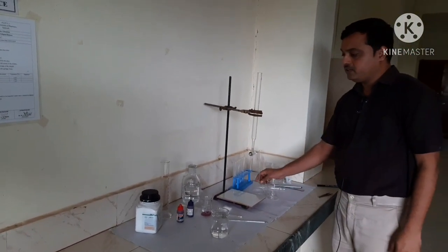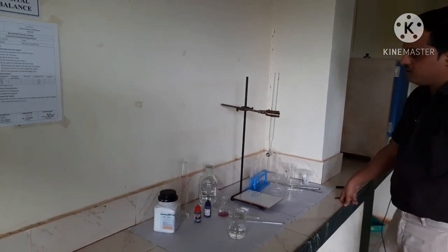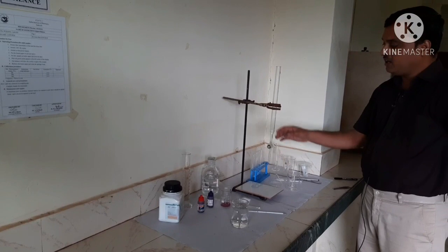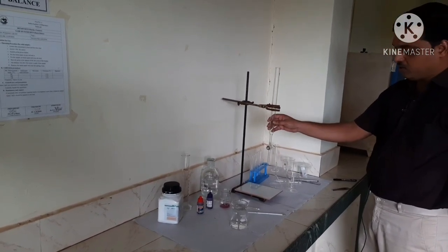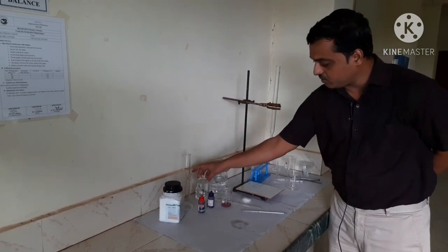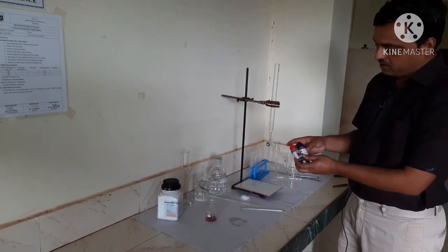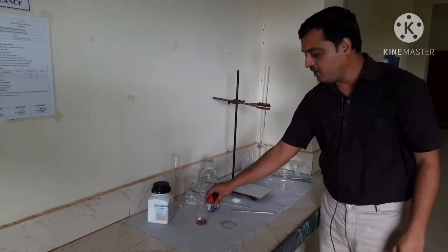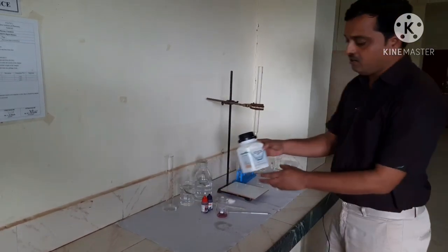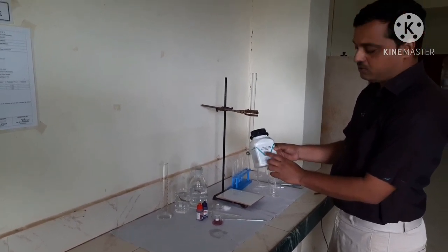Our aim is to separate the mixture of compounds using column chromatography. We require a glass column with a stand to hold it vertically, the solvent system of ethyl alcohol and distilled water, and a mixture of blue ink and red ink as the sample, already mixed in a beaker and adsorbed on silica. We are using silica gel 200 to 400 mesh size, and other glassware including a funnel and test tubes.